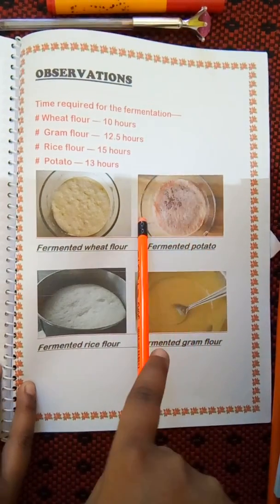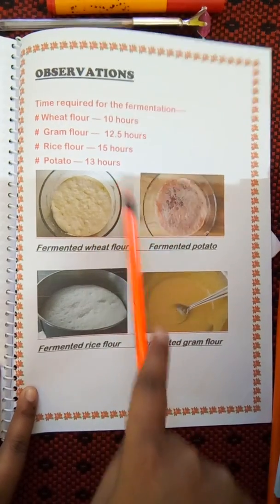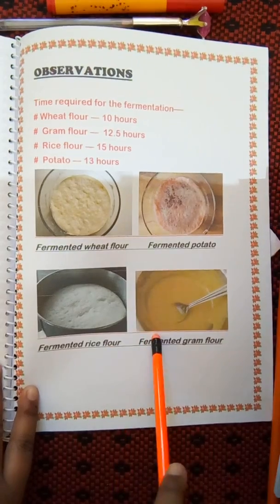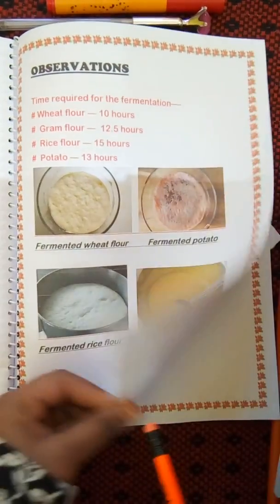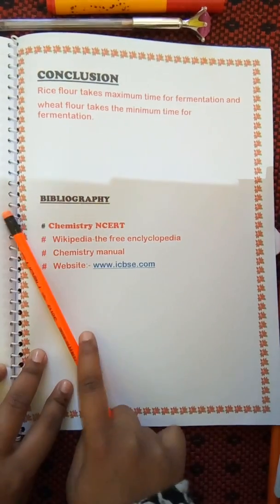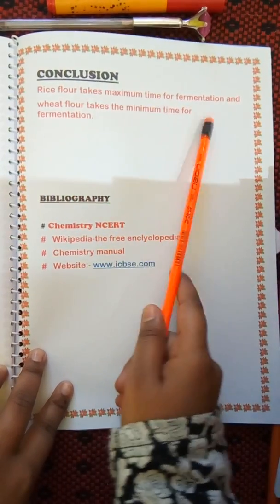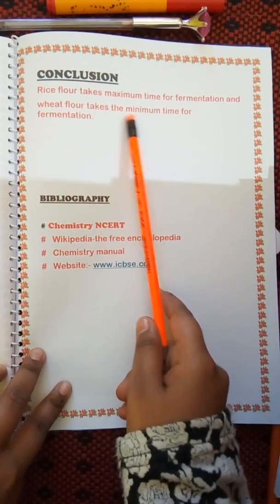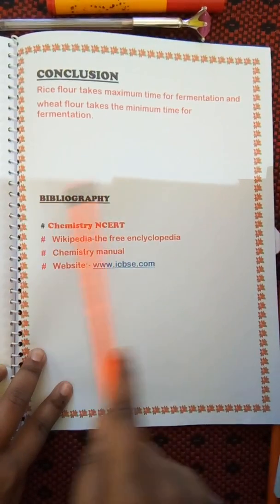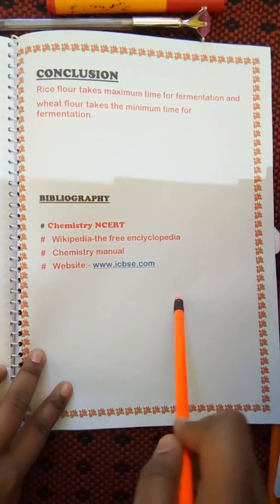This is fermented potato — since I used mashed potato, that's why it looks like this. This is fermented rice flour and fermented gram flour. On the conclusion page, I concluded that rice flour takes the maximum time for fermentation and wheat flour takes the minimum time for fermentation.